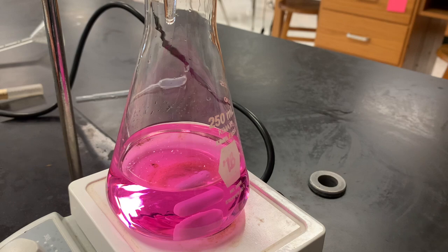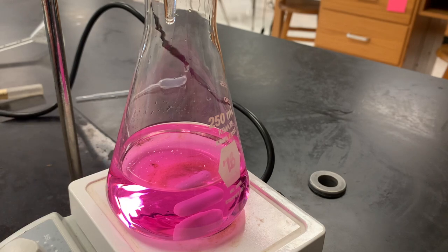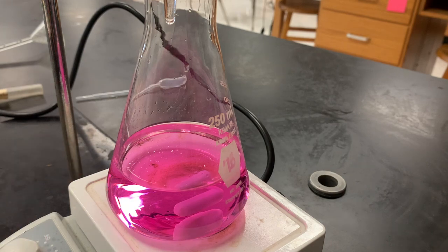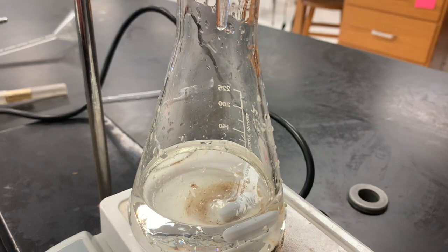This is all used to determine the acidity of the vinegar. One source of error I'll give you right now is that literally one too many drops went in here. If I would have been able to stop it — but I was trying to get my arm out of the way so you could see — that's my fault. If I could have stopped one drop prior, it would have been the light pink we want. So this is a little dark due to one too many drops of NaOH. Looking up here, you can see our final volume is right at about 3.7–3.8 mL. We'll get the exact number and put it in the data, and then we're going to do the same thing with 5 mL of vinegar and compare to see if we end up with the same molarity both times.